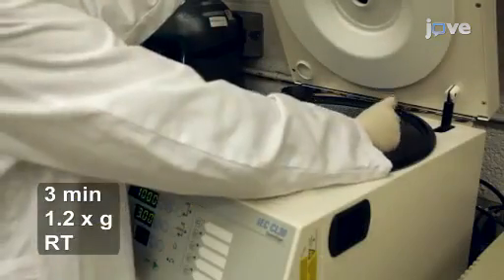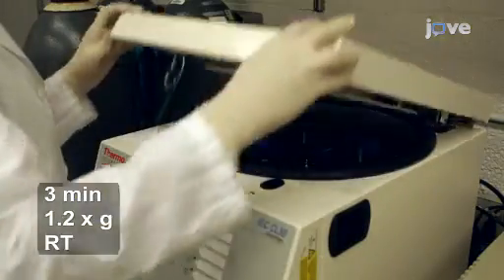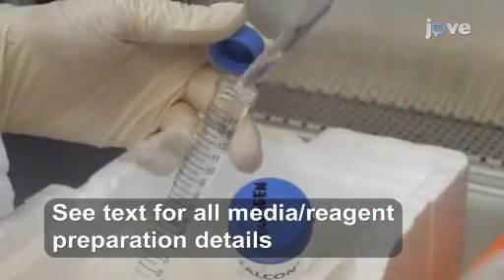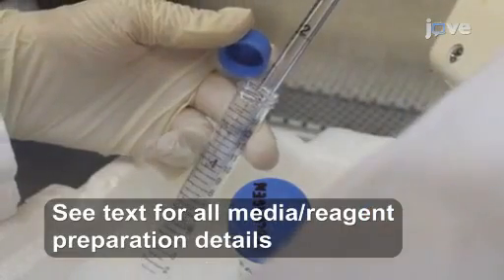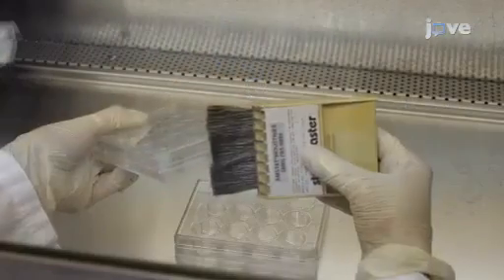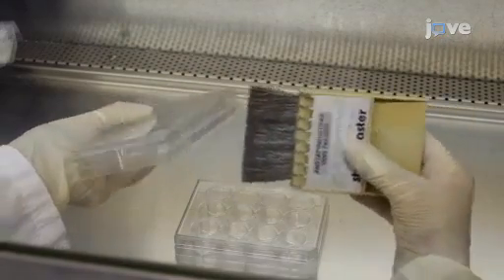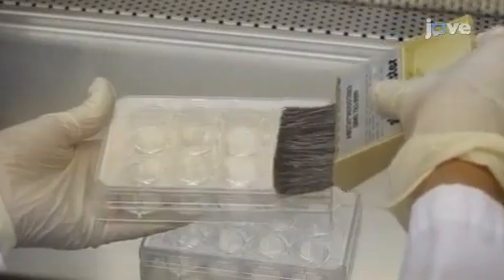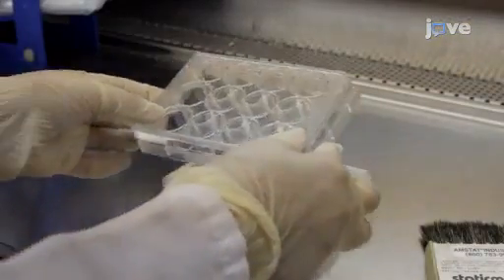Then, spin down 75,000 cells per gel and use a cold pipette to gently resuspend the pellet in 1.5 milliliters of collagen per gel without bubbles. Next, use a static reducing brush to wipe the borders, top and bottom of a 12-well plate, and place the plate on top of another empty static reduced 12-well plate.